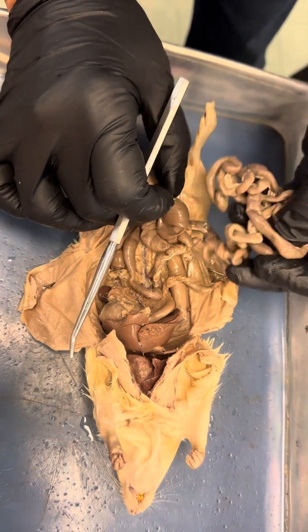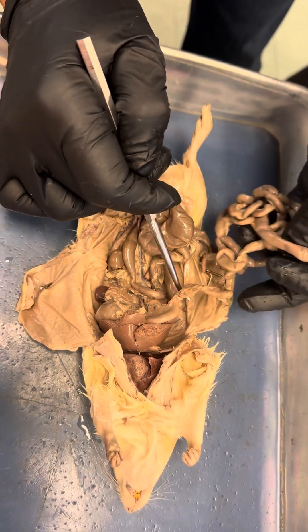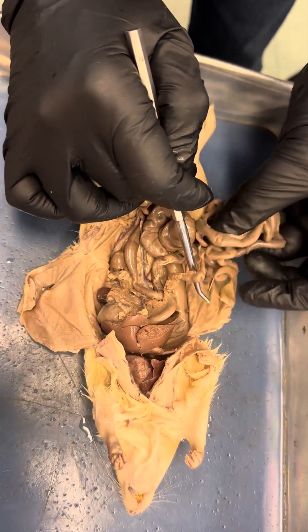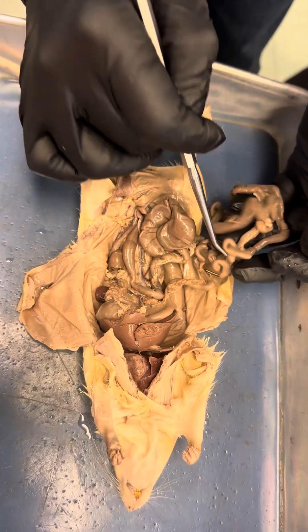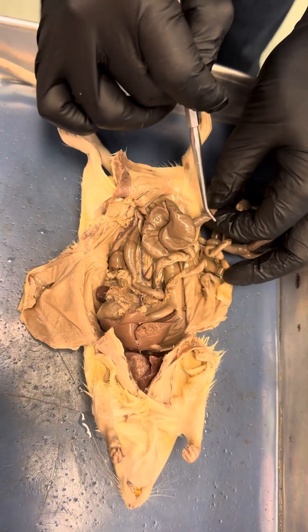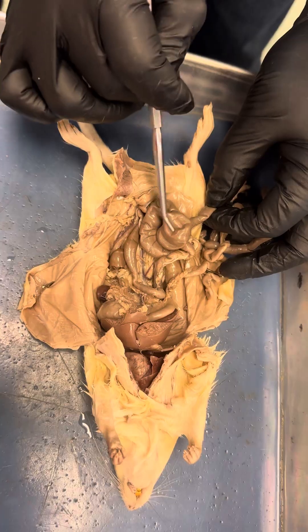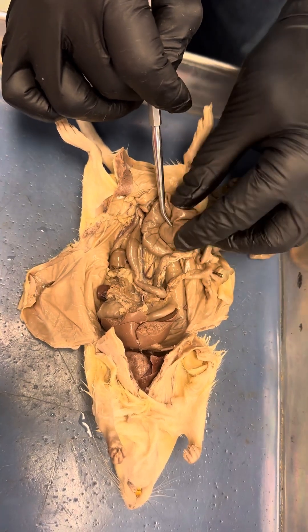And this is the duodenum — I can see it's already a bit torn. So this is the duodenum, this is the jejunum, and this is the ileum right here. The ileum is also connected with the cecum right here.